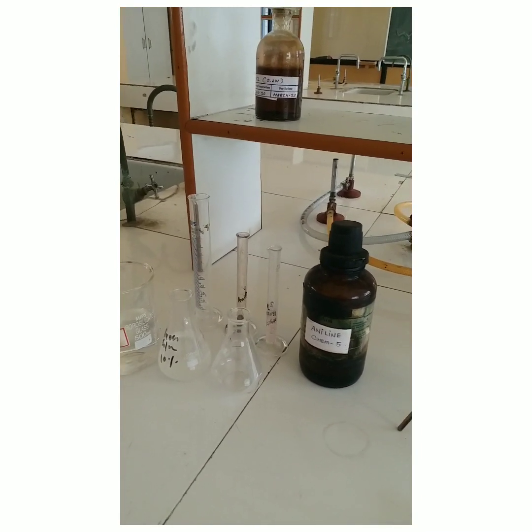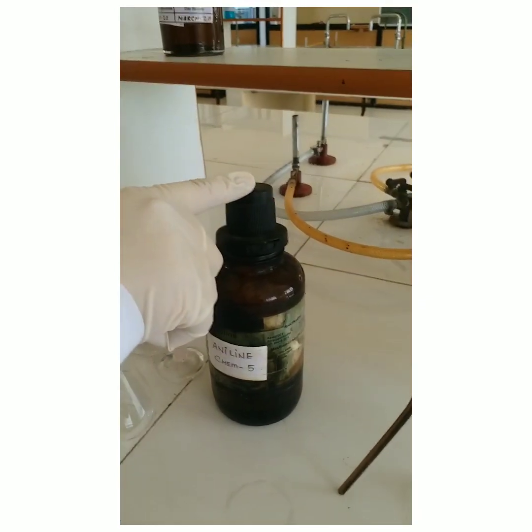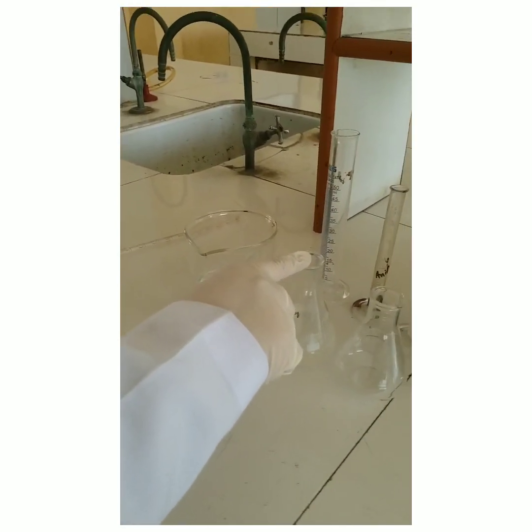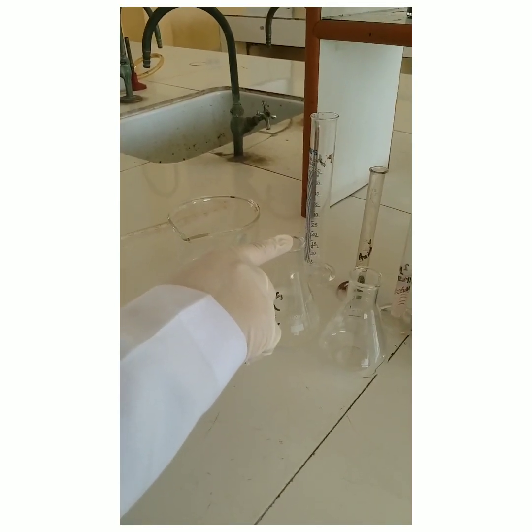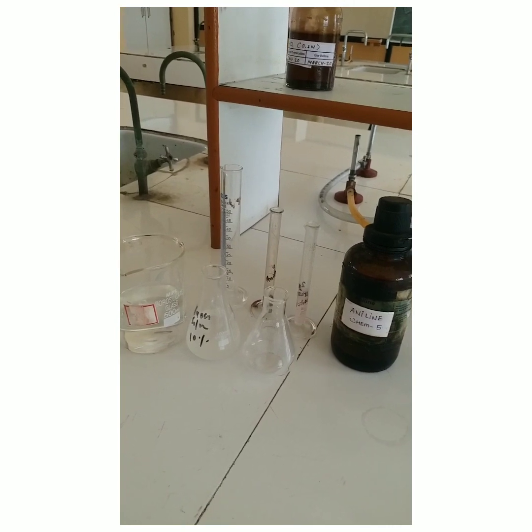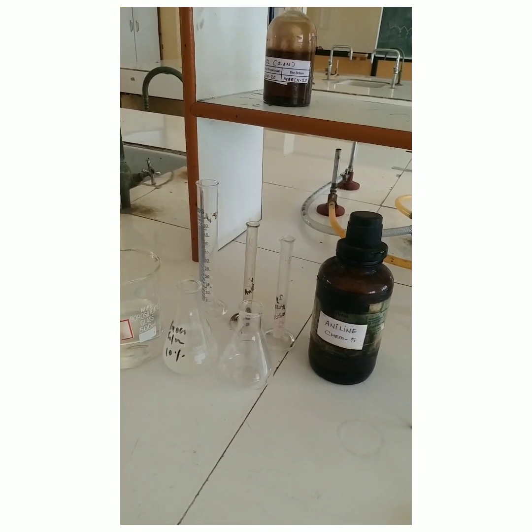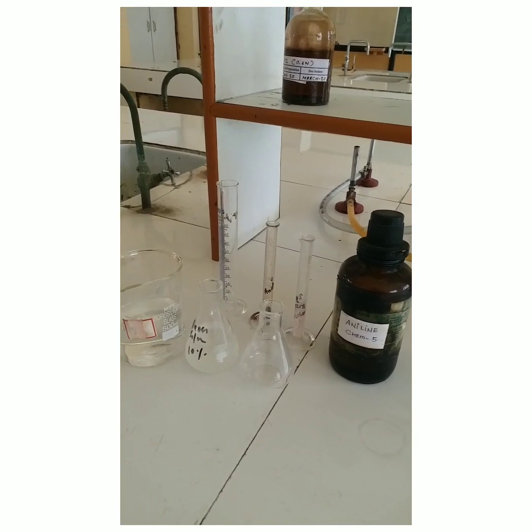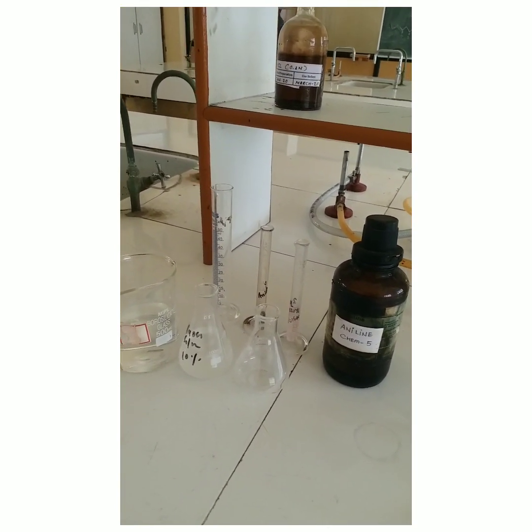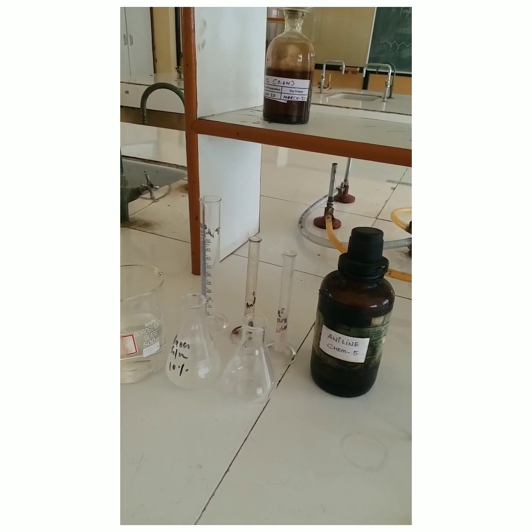Our requirements are aniline, benzoyl chloride, and 10% NaOH solution. Basically, benzanilide is the substituted amide derivative of aromatic carboxylic acid prepared by the Schotten-Baumann technique, where the acid chloride is added to the aniline in the presence of a base.